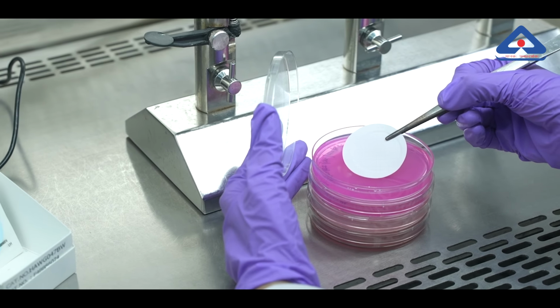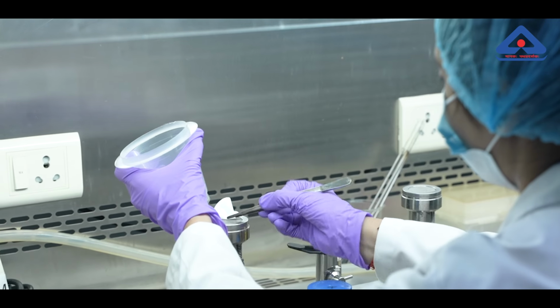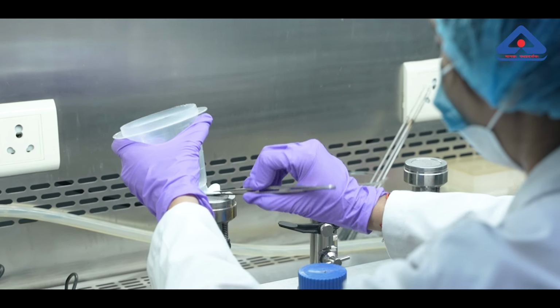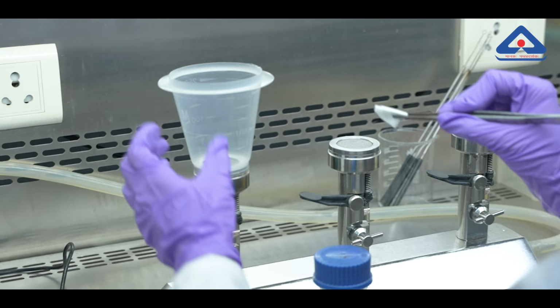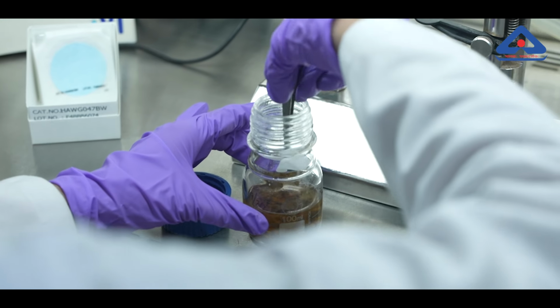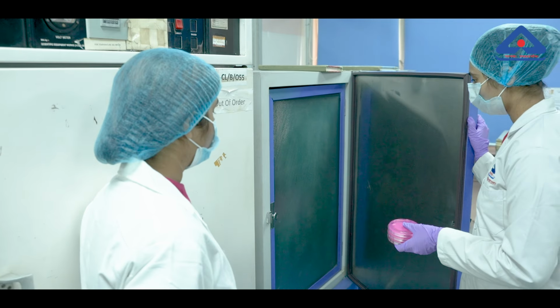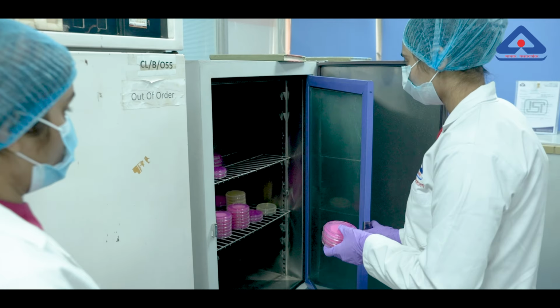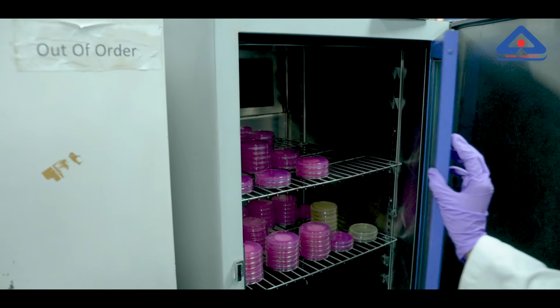After incubation, some bacteria need further enrichment in the medium, while other bacterial colonies are identified based on their initial appearance, such as color and morphology. After the initial detection of bacterial colonies, further confirmation is done through biochemical tests. These tests validate the presence of specific pathogens by analyzing their metabolic activity.